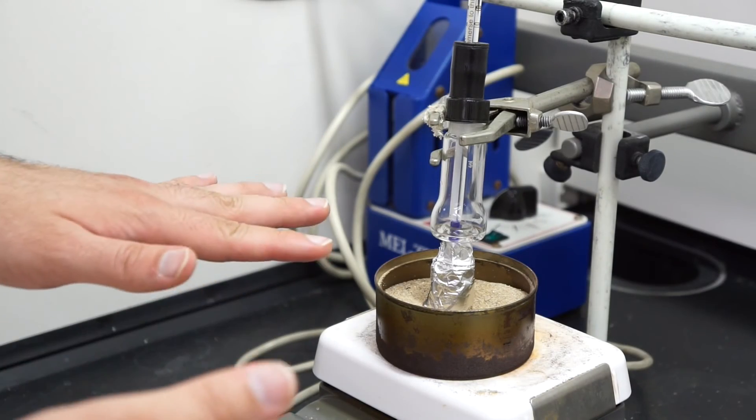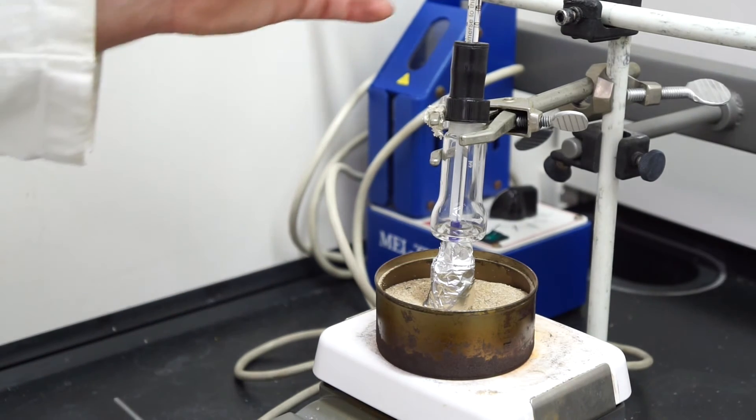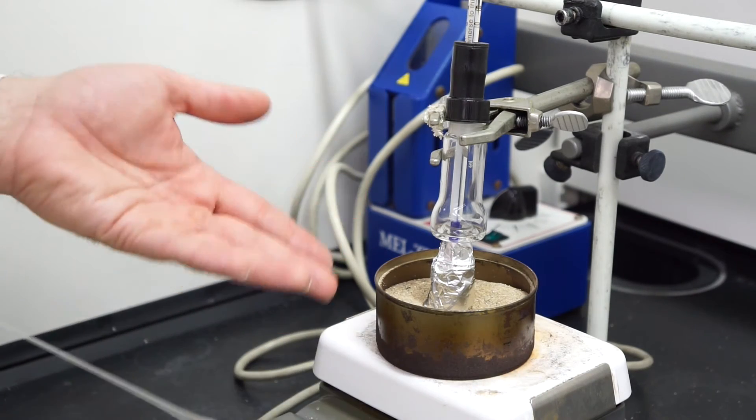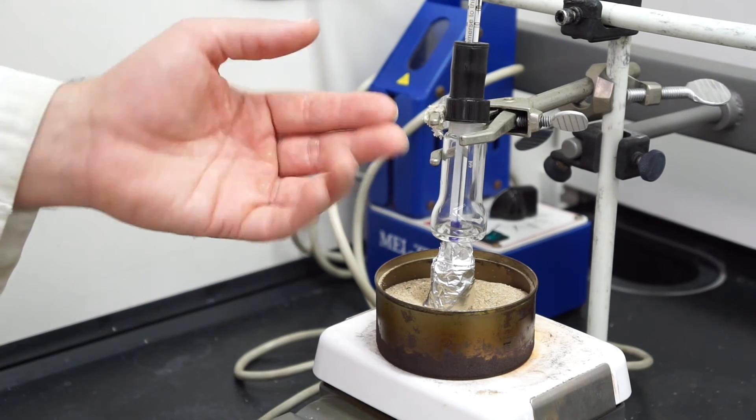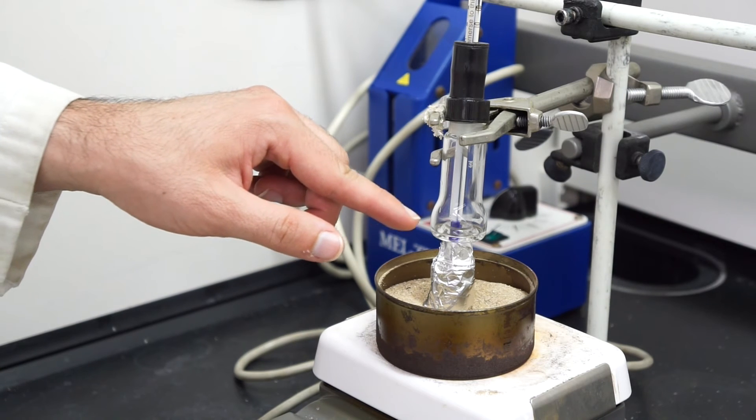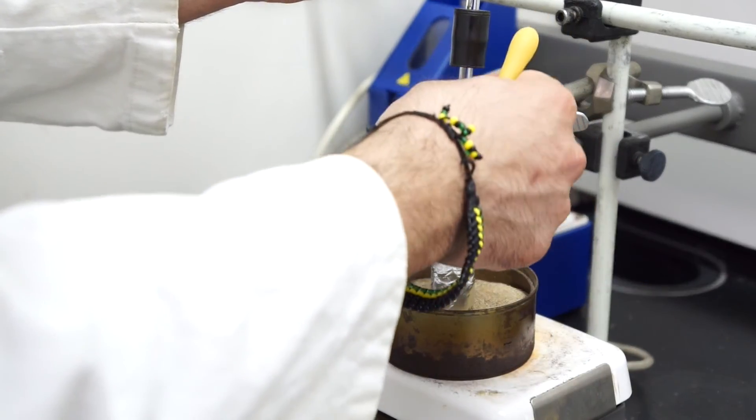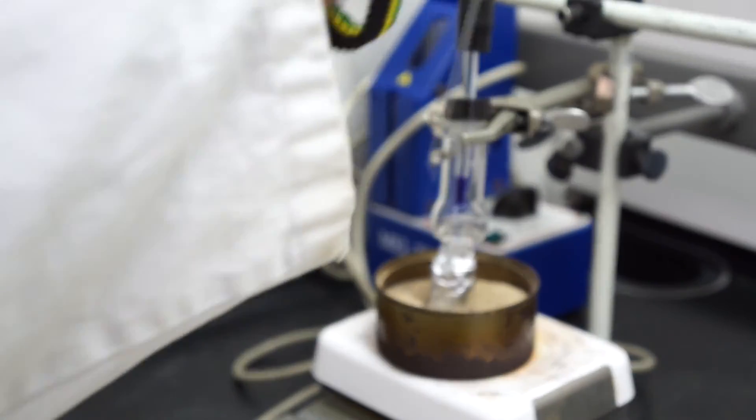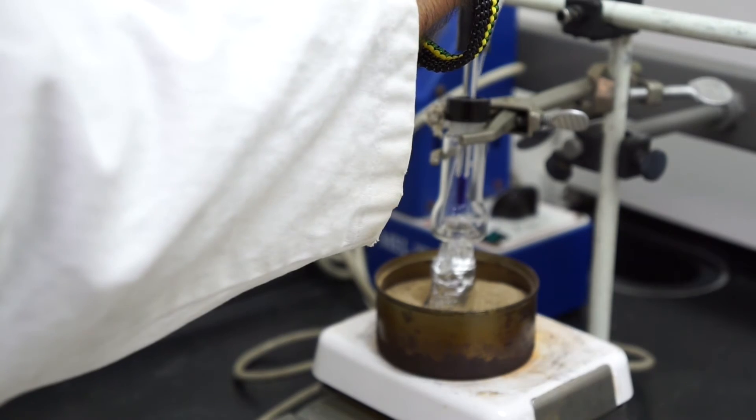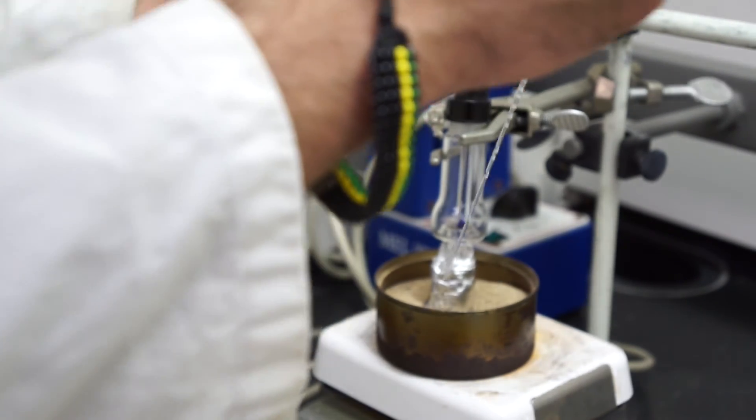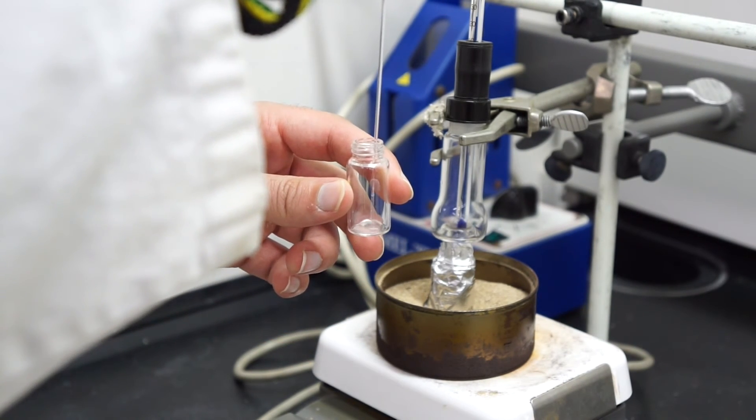Now I'm going to show you how to extract liquid from the moat. After you've heated your sample to the correct amount, which is probably about 15 degrees higher than the boiling point of alpha-pinene, it's going to collect in here. Remove the stopper, open it to the side. Take your long pipette, stick it in, and extract the liquid. Pull it out, take a vial you've already weighed out, and transfer the liquid into the vial.